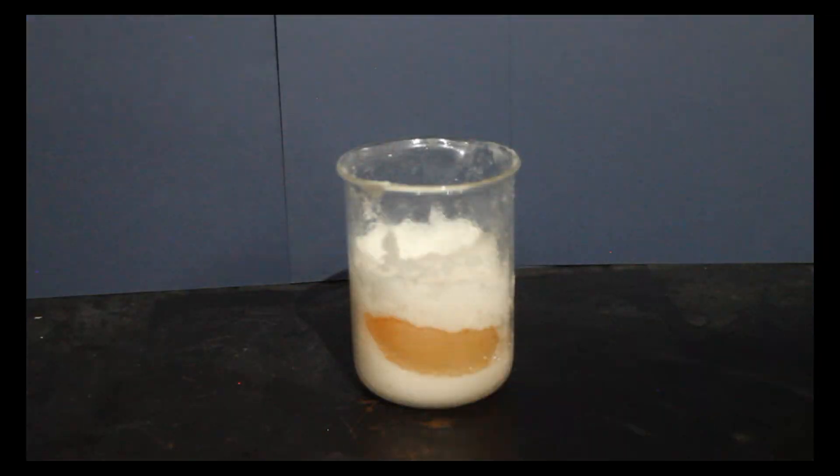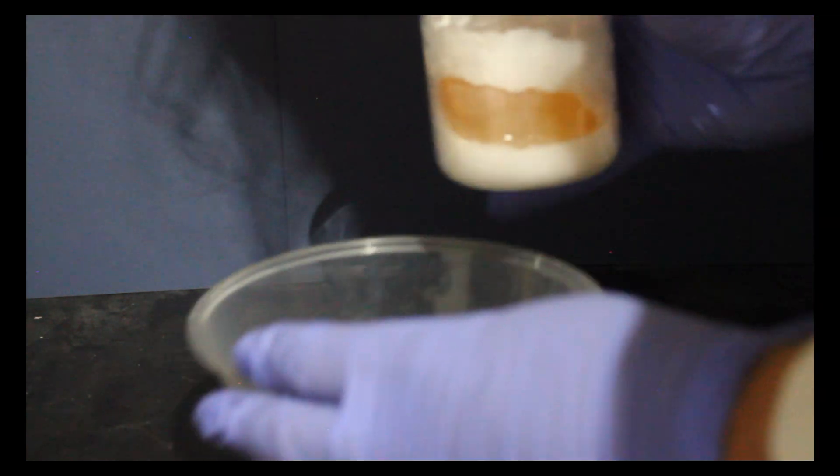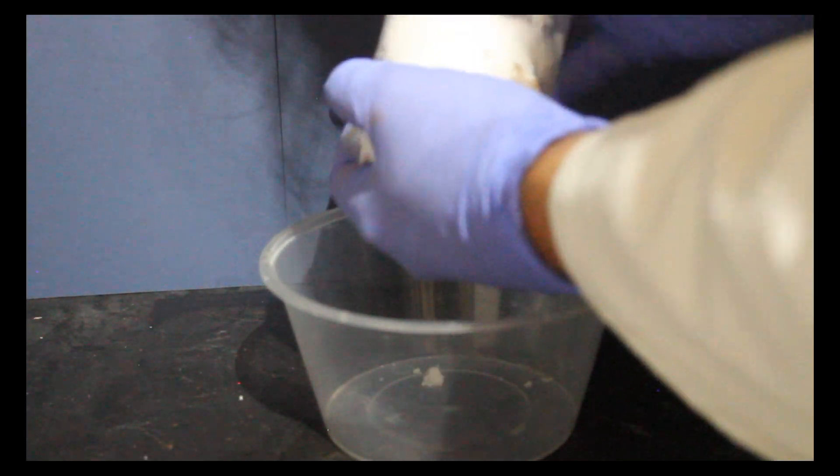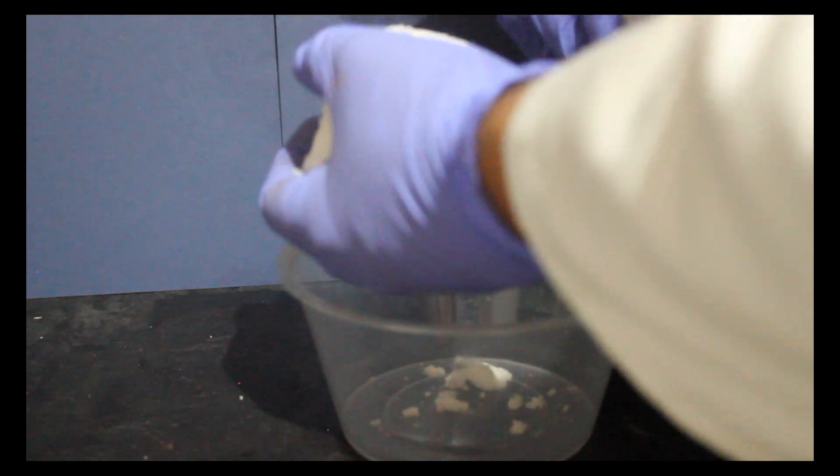Let's see if our high salinity cell did any better. So we'll pour all of this out and then scrape the salt away from the egg.